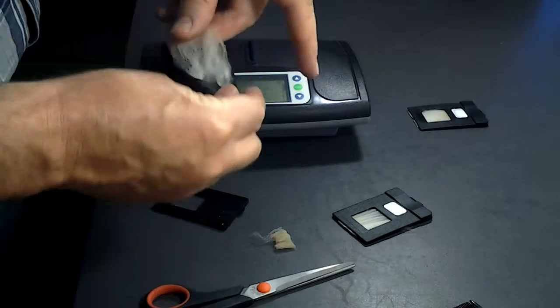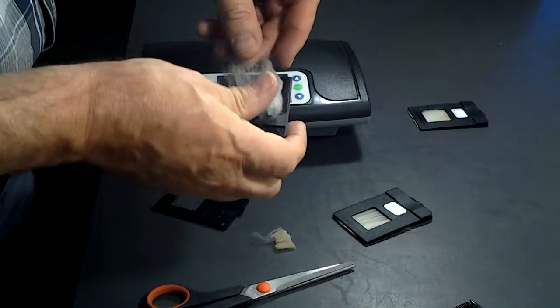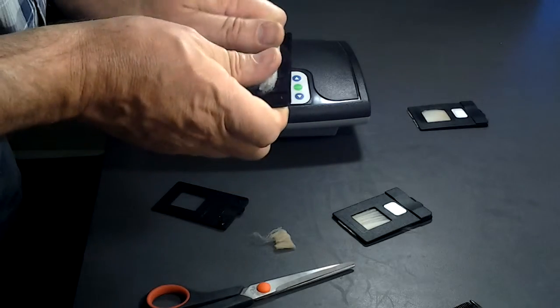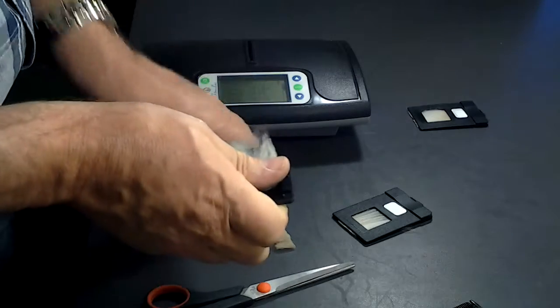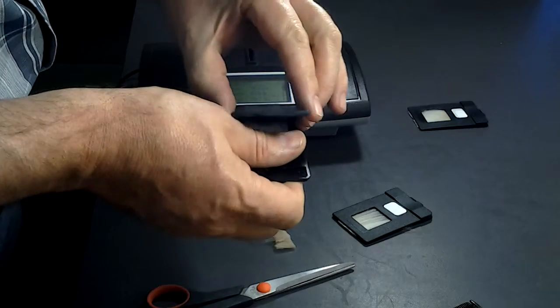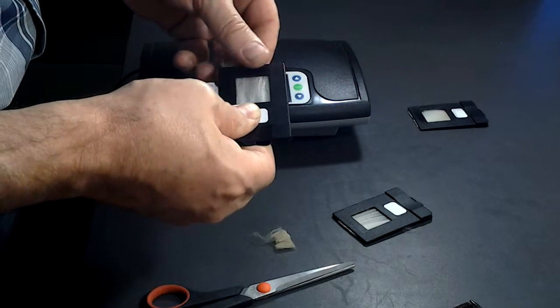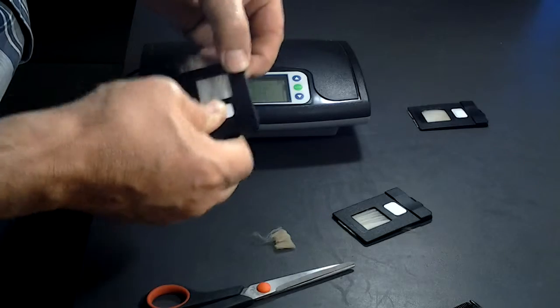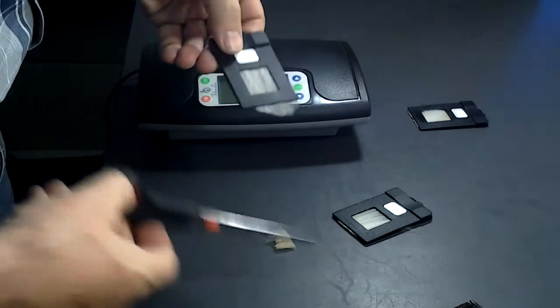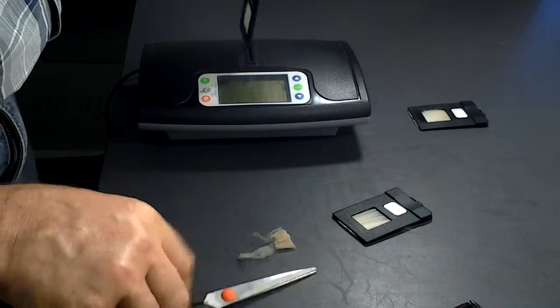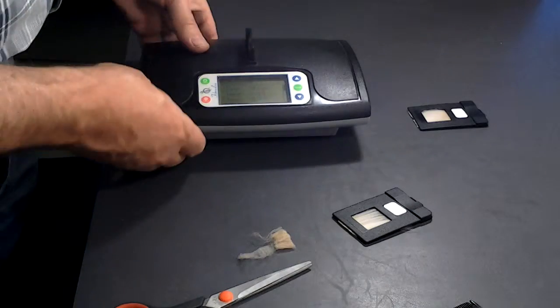Lay it on your side there. Cover it. If you can, stretch it slightly. Now you are ready for measurement.